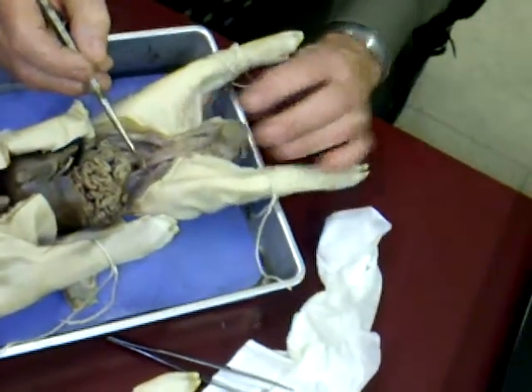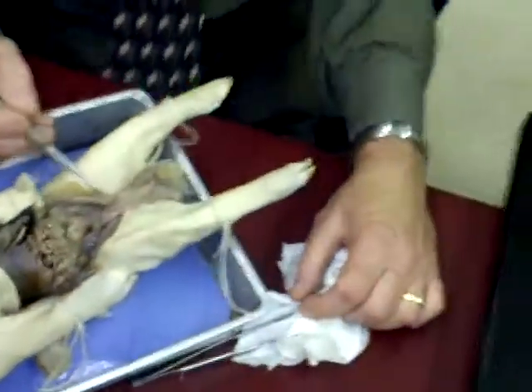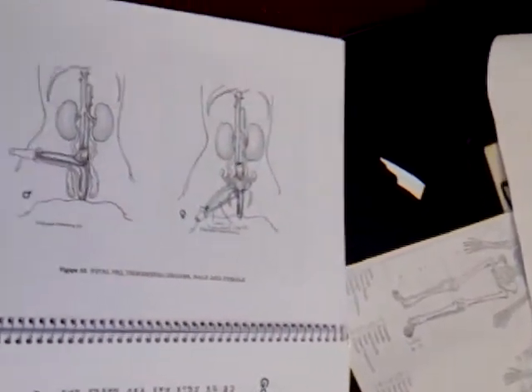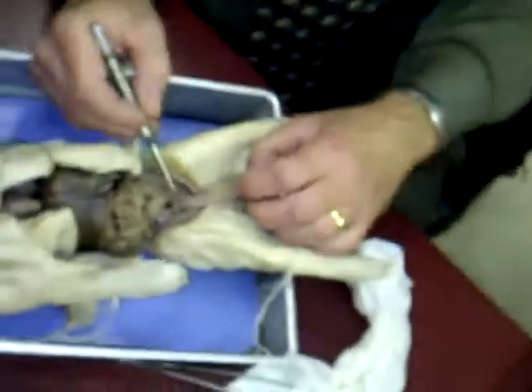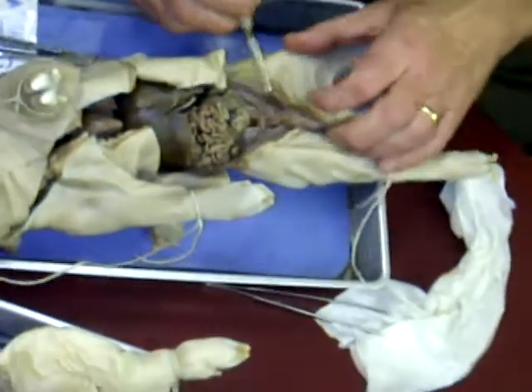And the book is actually slightly inaccurate. It shows them both entering the base of the bladder where the urethra starts. And by the way, that area will differentiate later on into a prostate and seminal vesicles and all that reproductive stuff that a fetal boy doesn't need, so they're not developed yet. But they actually come together into like a little T-strap to a common duct that goes into the base of the bladder where the urethra starts. But now look where it's coming from.